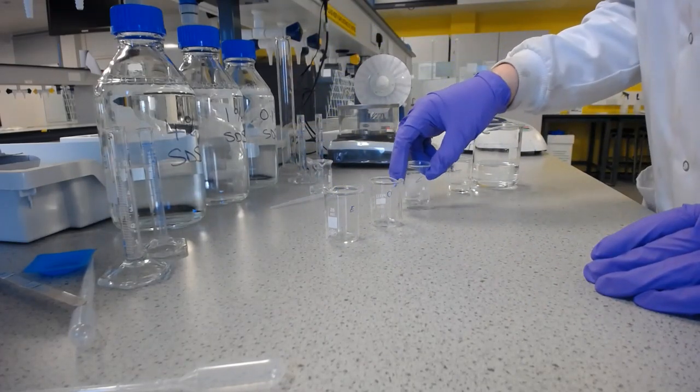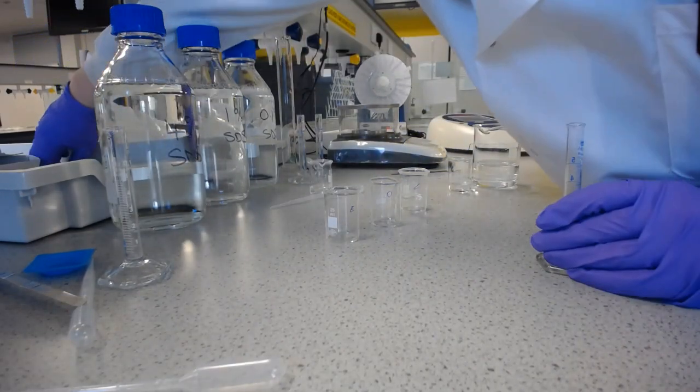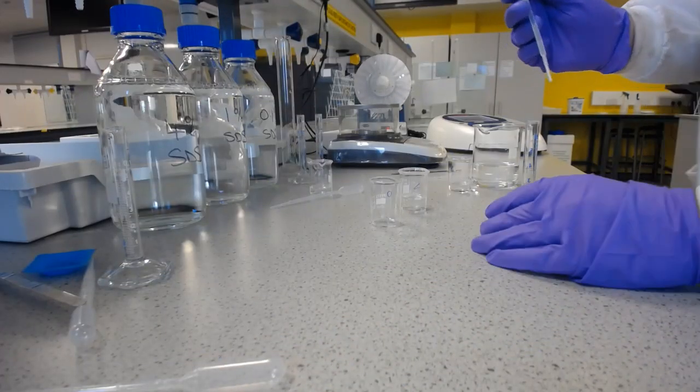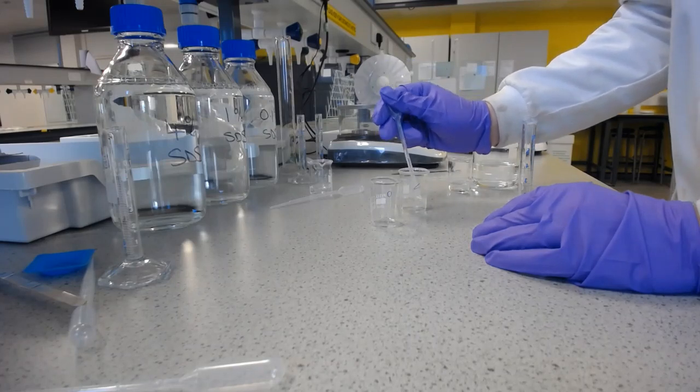And so, again, we'll do that one more time. Don't need that last beaker, we're only going to do that one more time. Just making sure this is fully mixed.